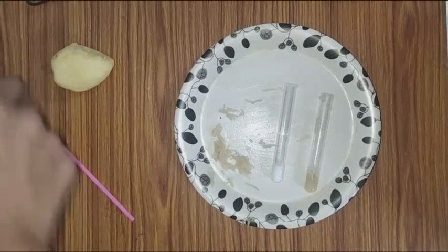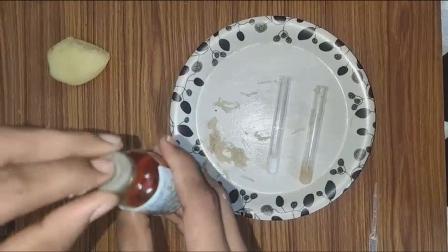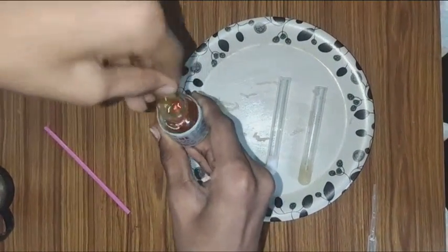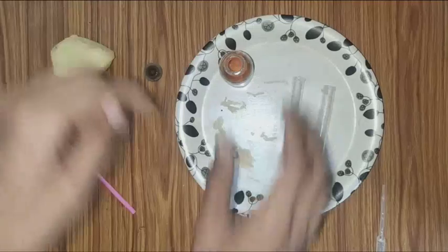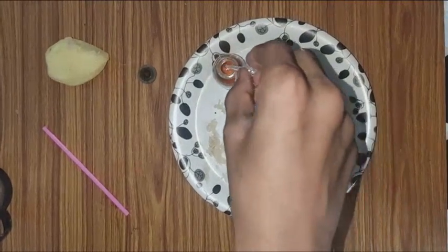Now we have to take the bottle of iodine and open it. As you can see, I am opening it. Now, take the dropper and fill it with iodine.